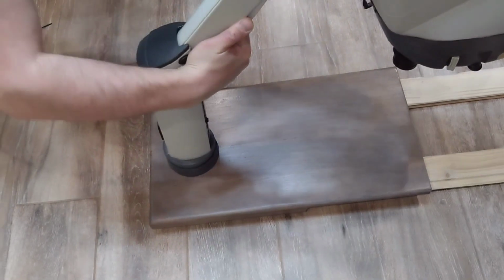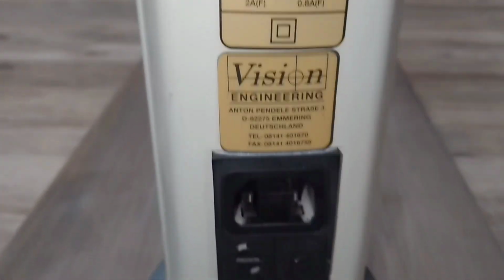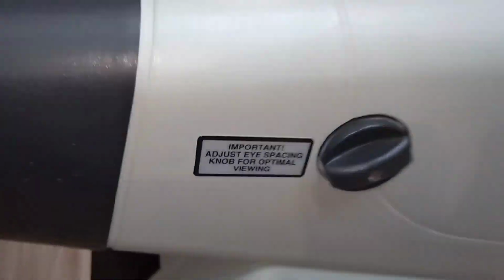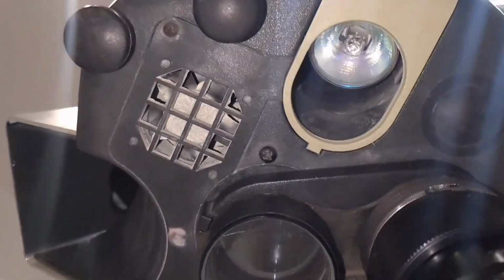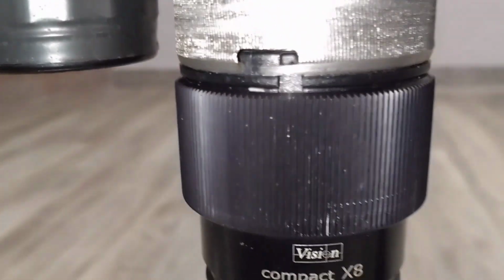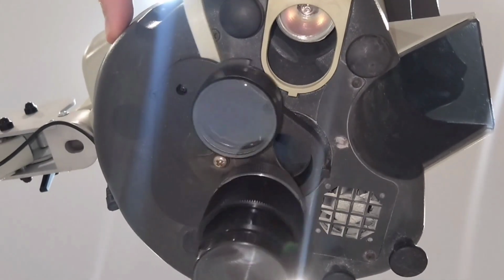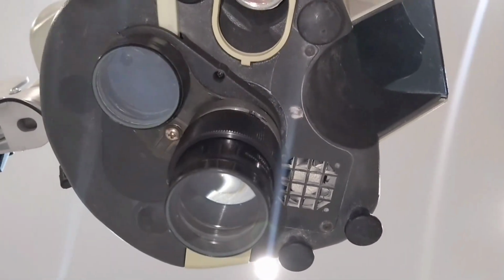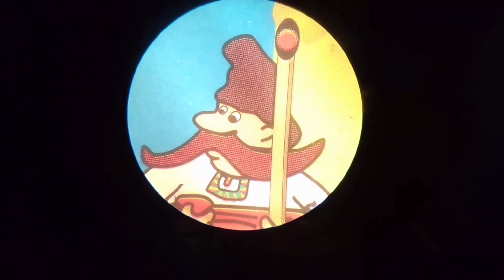Vision Engineering's Mantis microscope with magnification of 2, 4, 6, or 8 times. Since this microscope does not have eyepieces but simply a screen, the eyes get less tired, allowing for longer viewing of the object, and overall it is much more convenient. This microscope can be used for repairing various electronics, in jewelry making, in dentistry, and probably in many other areas.